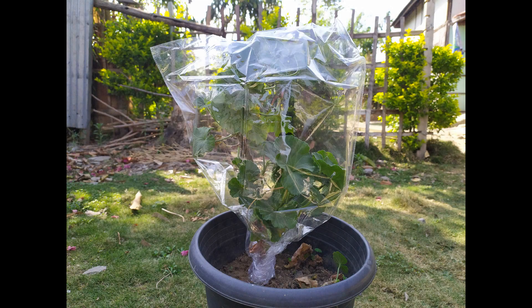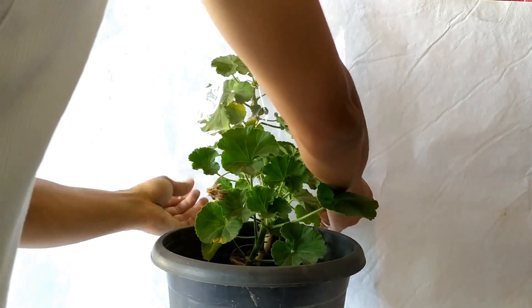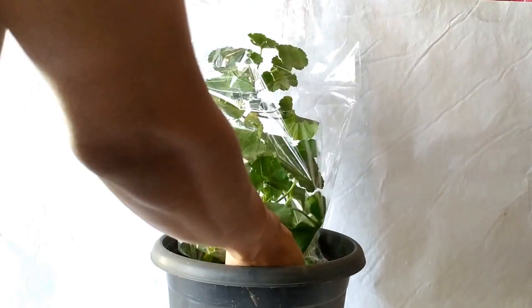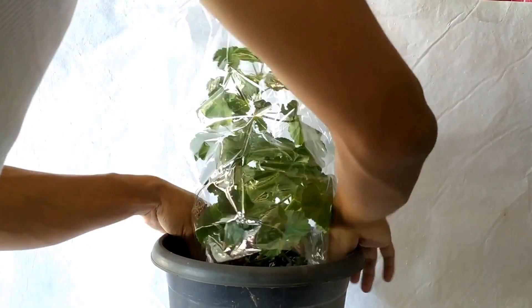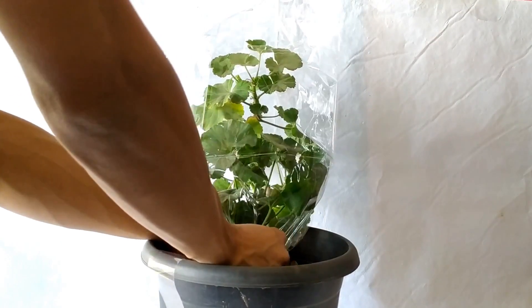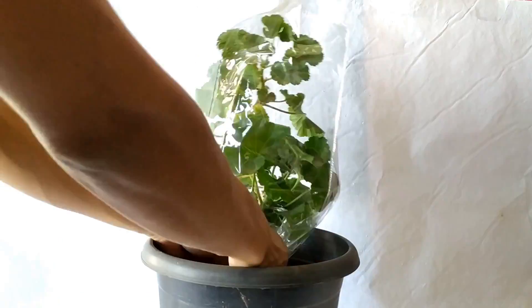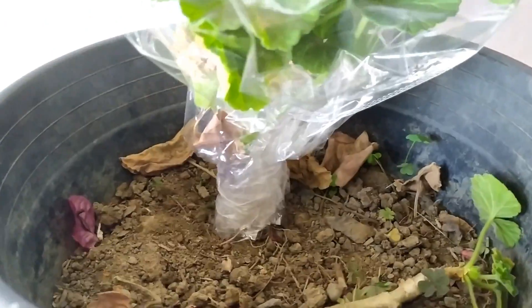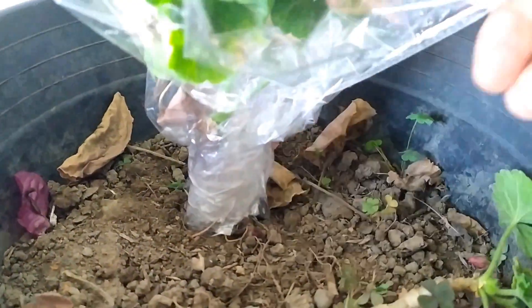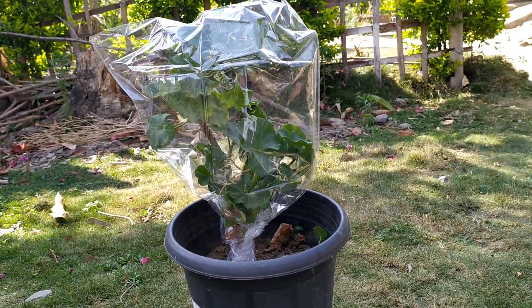Alternatively, you may use the plastic bag method for this experiment. Take a potted plant and cover the plant using a large plastic bag. Seal the opening of the bag around the base of the stem of the plant using sticky tape. Leave the setup in sunlight for a few hours.